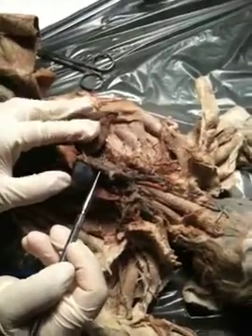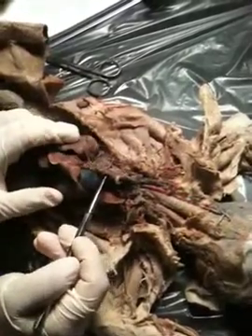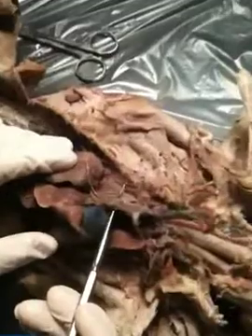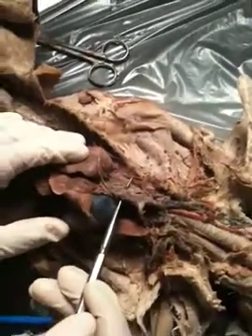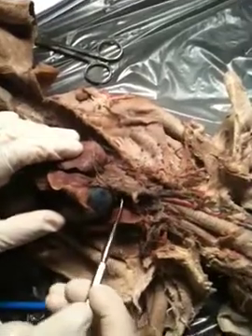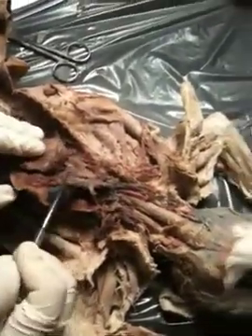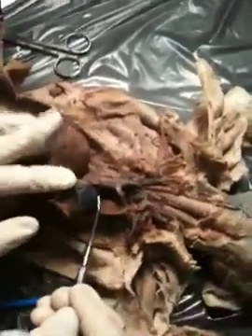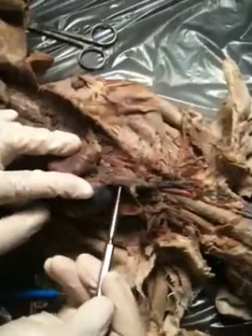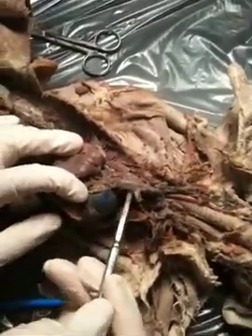We're here. We have a cat carcass, or cat cadaver, and we're actually trying to distinguish the cat veins. We're going to start off with the brachial or the thoraco-cervical area. As you can see there, we have the heart, and above the heart, you're looking at the superior vena cava.